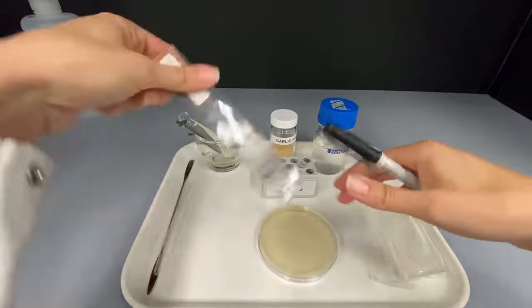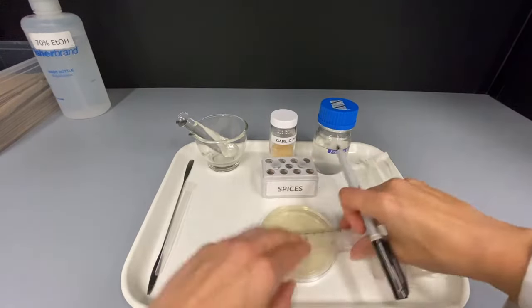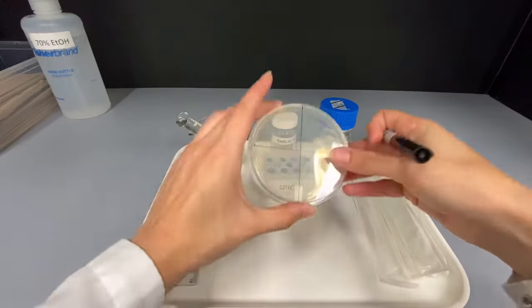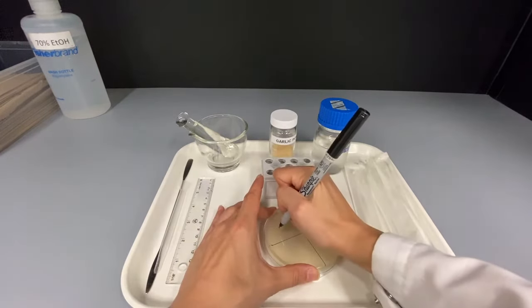With the lid side down, divide the plate into four approximately equal sized areas using a ruler and sharpie. Using small writing, label the center of each section with the test substance you'll be using.